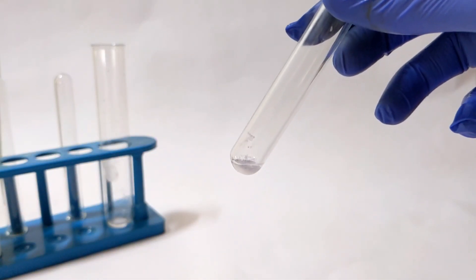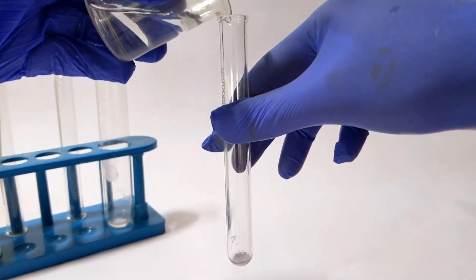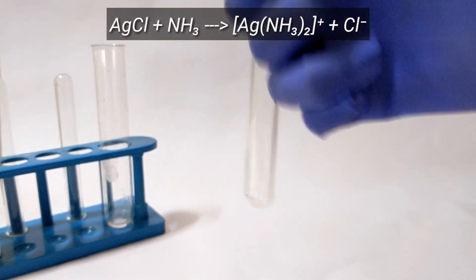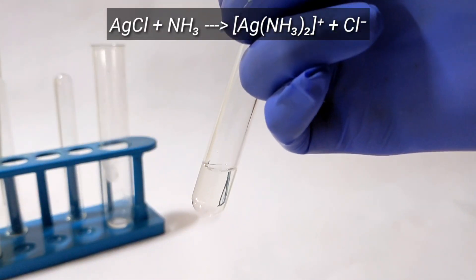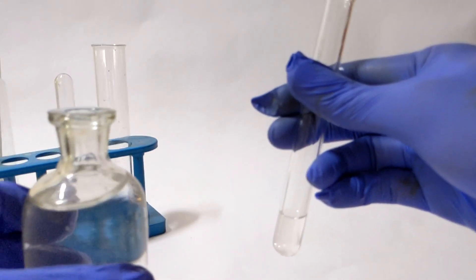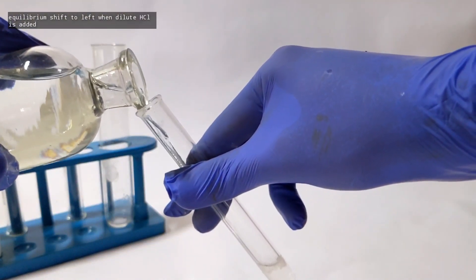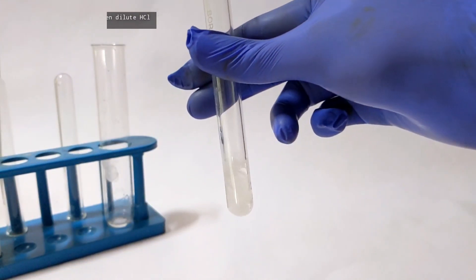Now we take some amount of that same white silver chloride precipitate, add excess ammonia solution, and shake it well. The white precipitate dissolves and a clear solution is obtained, due to the formation of the soluble diamine argentum complex. Dilute hydrochloric acid or even nitric acid will neutralize the excess ammonia in this complex and the precipitate reappears because the equilibrium shifts to the left side.